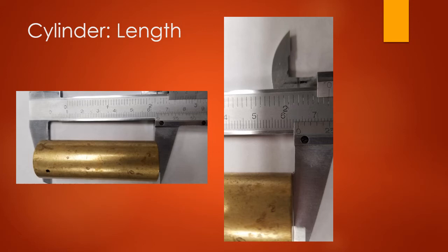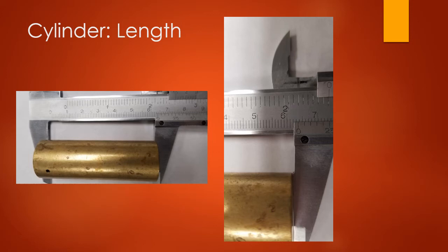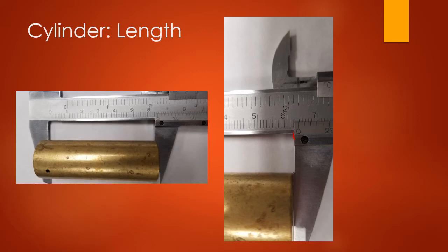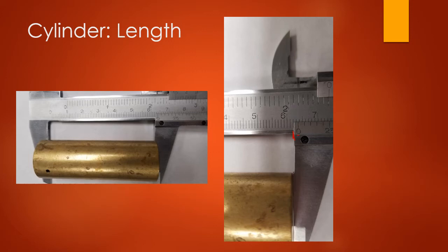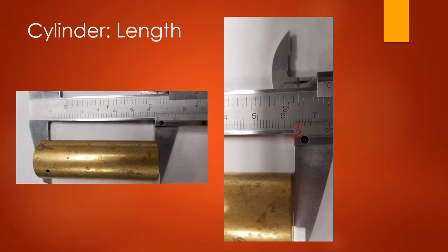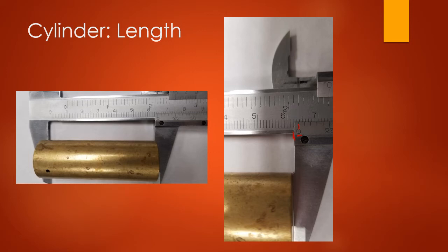Now at number three, we take measurements of a cylinder. We are using a caliper instead of the plastic metric ruler described in the lab manual because it's more accurate for this small cylinder. With a caliper, you don't take the measurement from the outer edge — that's a common mistake. Instead, take it from where the zero is. You can see the zero with a dash above it — that's where we take the measurement from. Since it is a ruler and goes to the tenth place, we always go one past, so we report the cylinder length to the hundredths place — two decimal places.